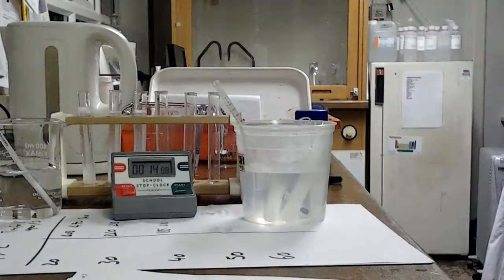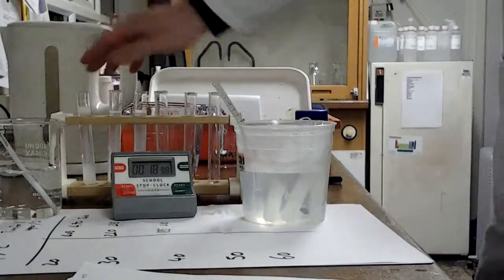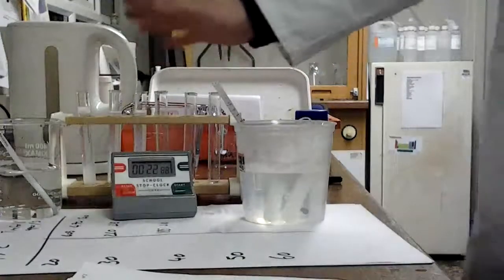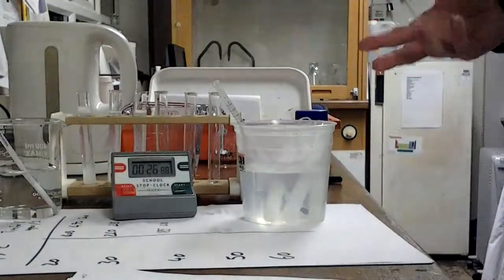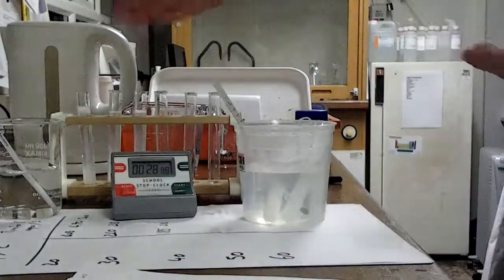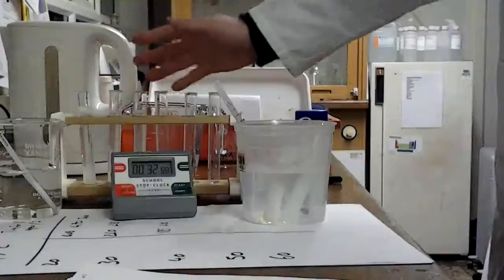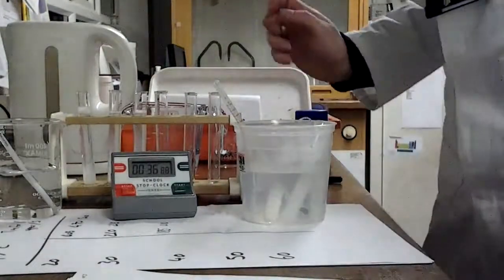Now, one thing I will say about this experiment, at the end of it you're going to have a lot of test tubes with partially broken down milk and enzyme in it, and you need to dispose of that. It can go down the sink, but you do need to rinse the test tubes out, because otherwise they have this kind of nasty dairy residue on them. Give us a whole class of test tubes like that, it's going to start to smell a bit like a cheesemonger. Okay, so when packing this one up, you've got to clean up after yourself reasonably well.